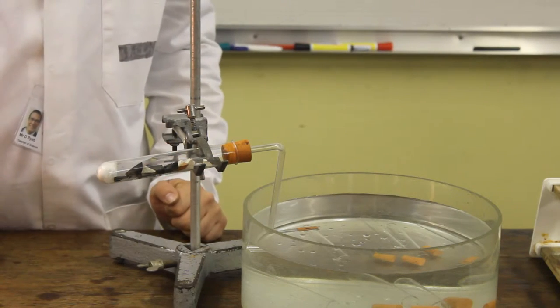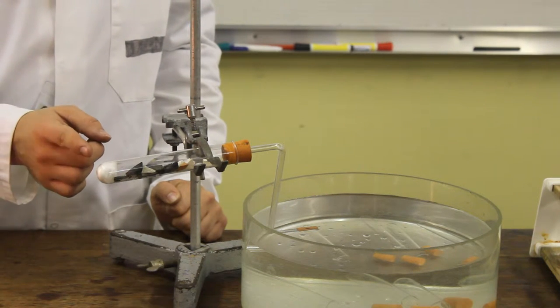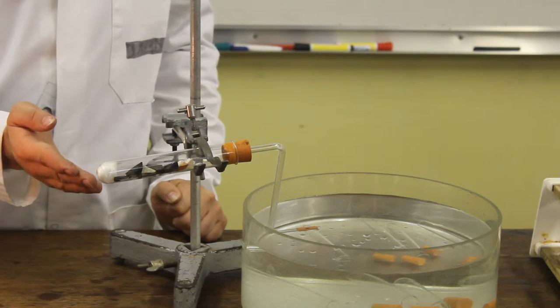This is a demonstration of the cracking reaction. Inside the boiling tube, we have mineral wool soaked in paraffin oil.